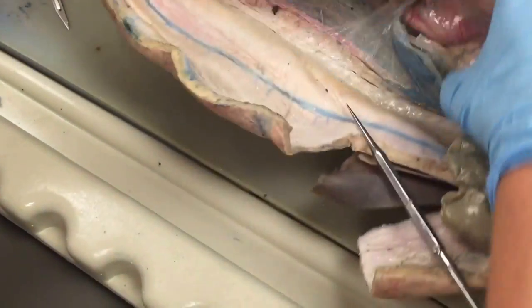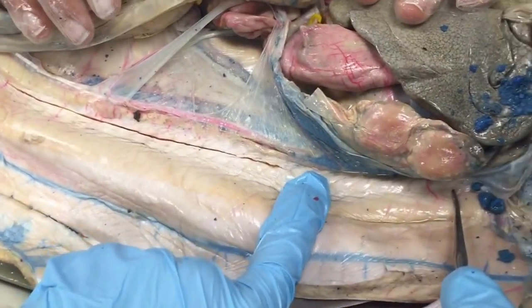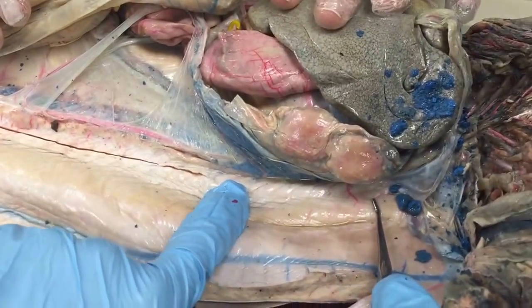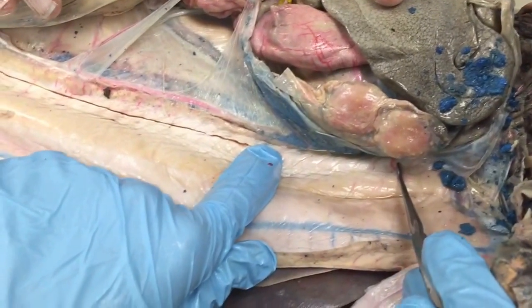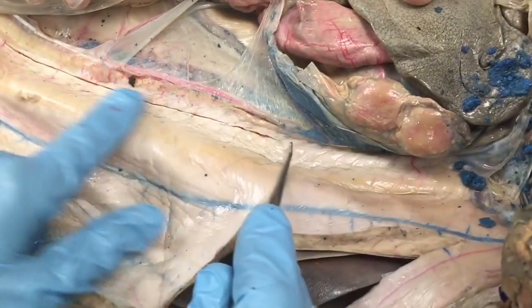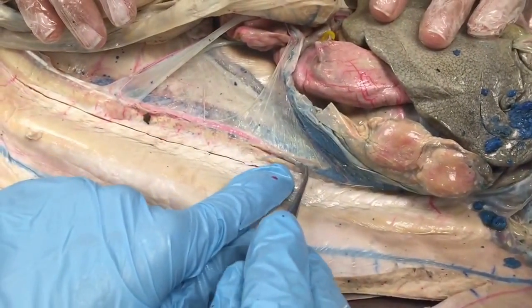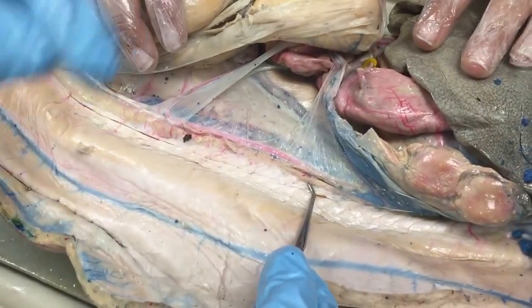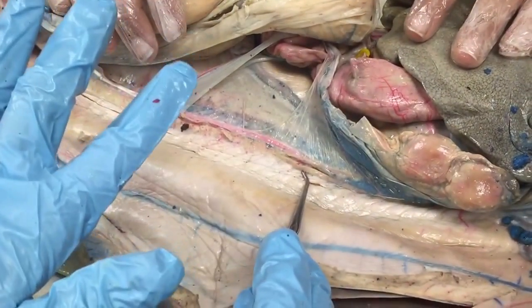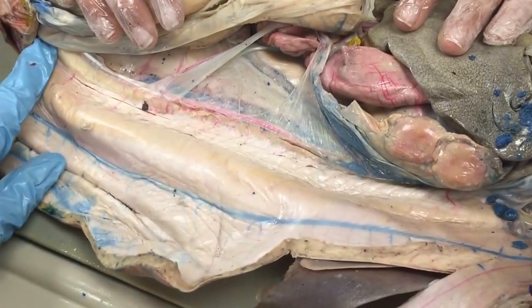Now let's look at the urinary part, which differs quite a bit in males and females. The top third of the kidney in females is basically vestigial — they don't really use it. It's been modified to become the Leydig's gland in males, which helps produce the seminal fluid. So just the bottom two thirds is actually functional kidney. You can see all of this kidney tissue — that's how it would appear in the male if the ductus deferens and seminal vesicle weren't sitting on top of it. In the female, it's just the kidney tissue you're seeing.